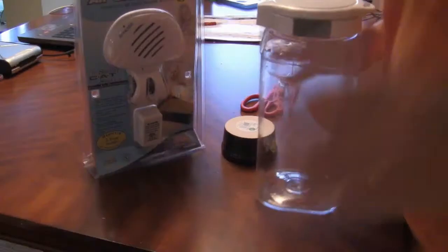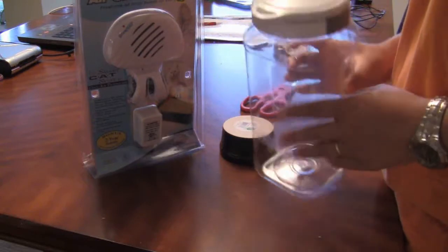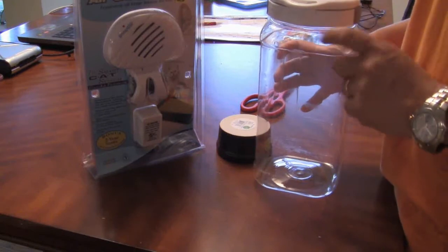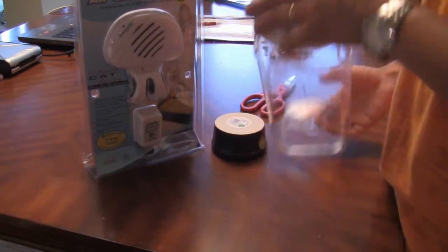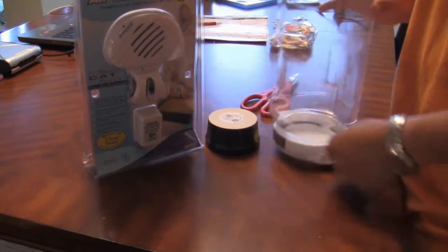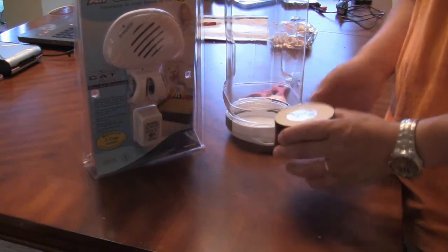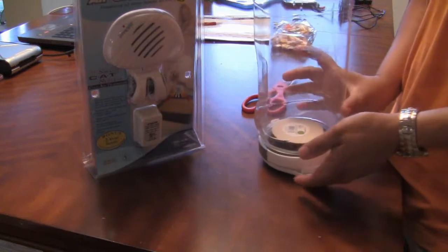What you need is a container — preferably a thick glass container. Right now I'm only using a plastic one, but I would recommend heavy thick glass. This one was on sale for about two bucks. The good thing about this container is that it has a lid that allows you to open and close it easily. The next thing you need is a ceramic cup or container which will fit snugly into the plastic canister.